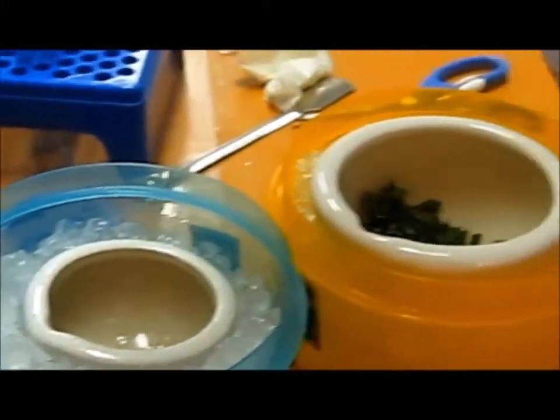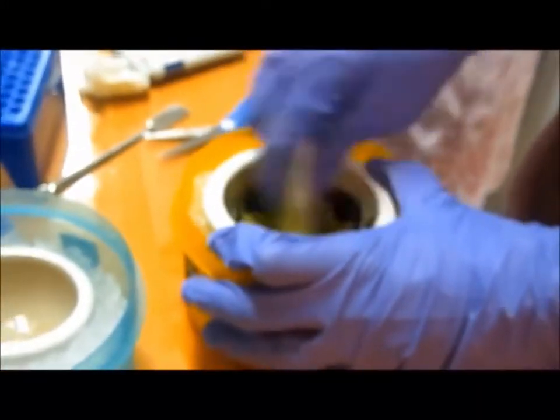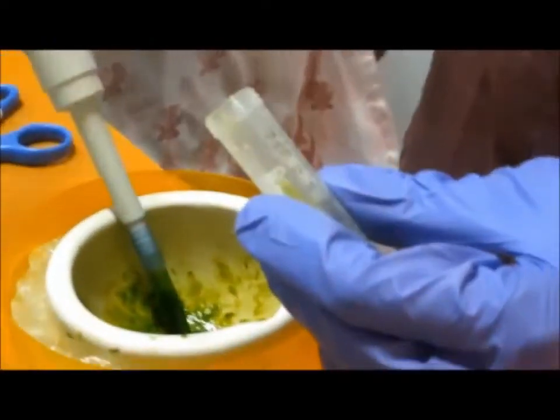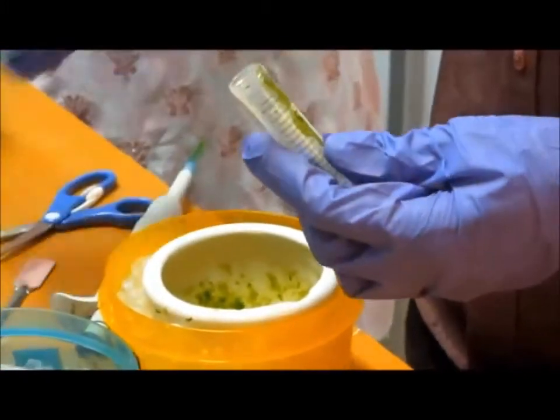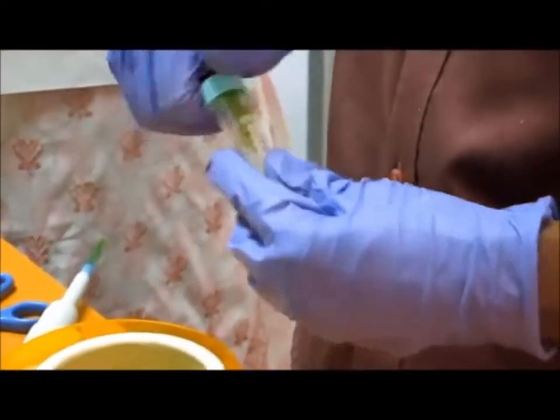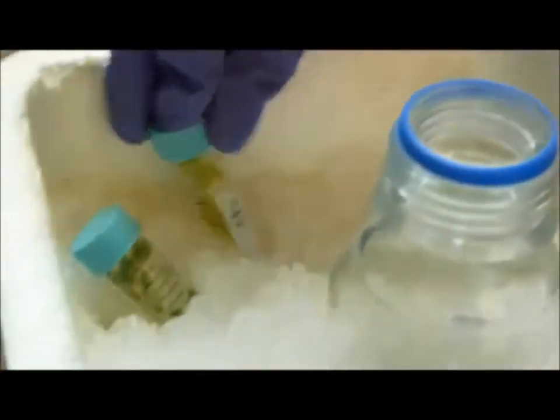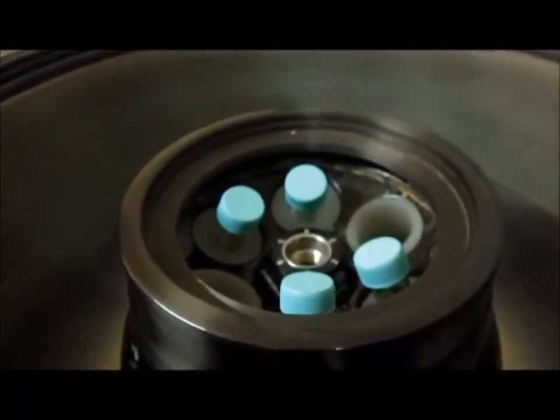The extract is then collected in centrifuge tubes and kept in the icebox. The tubes are placed in the centrifuge machine and centrifuged at 20,000 rpm for 20 minutes. After that, the supernatant is collected and used as the enzyme source.